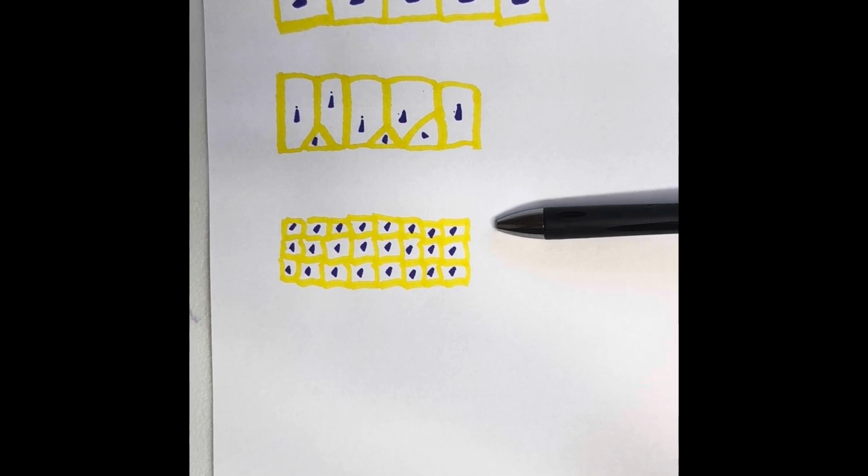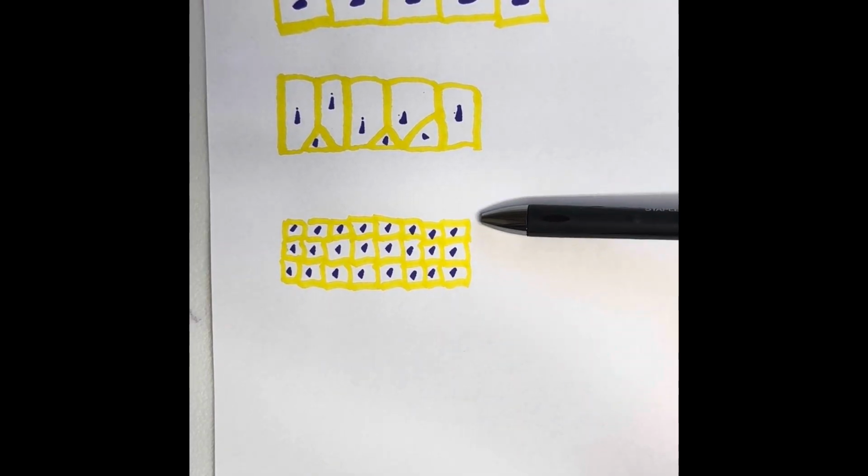We're going to go ahead and move on to stratified. Only one layer touches the basement membrane. All of the other cells are stacked on top of each other. Boom, boom, boom, boom.